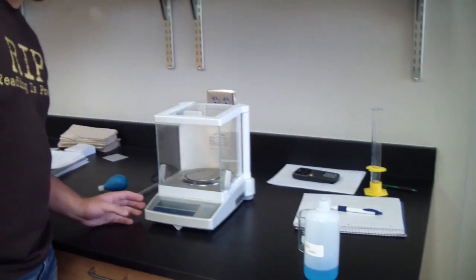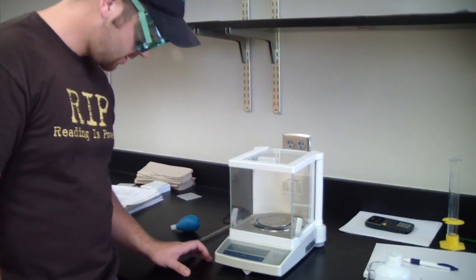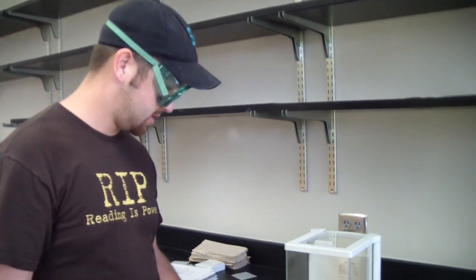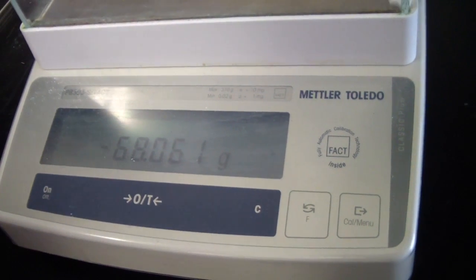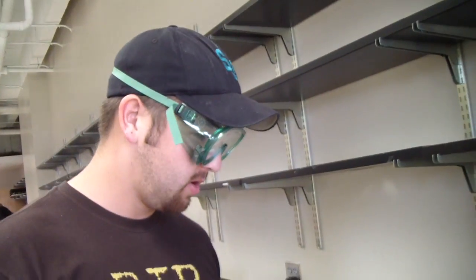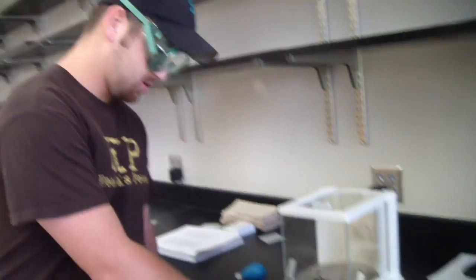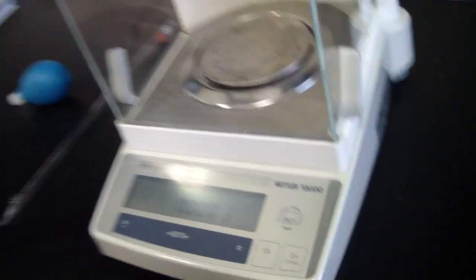Today we're going to be doing the density graph using the analytical balance. As you can see, sometimes the balance becomes off. It doesn't start at zero. Many things can cause this, such as very sensitive balances, people leaning on the table, airflow, or other things. As you tare it, just push this button right here to make sure it's taring back to zero.